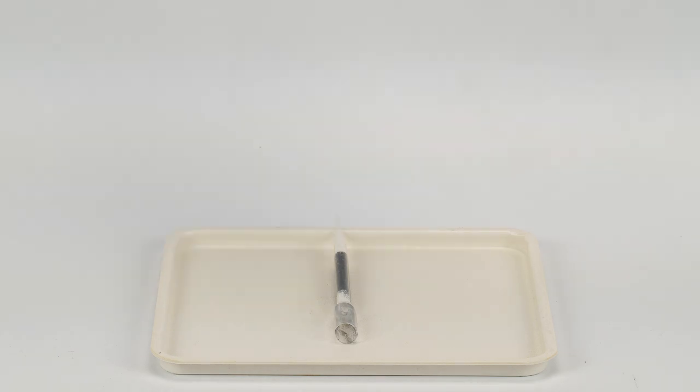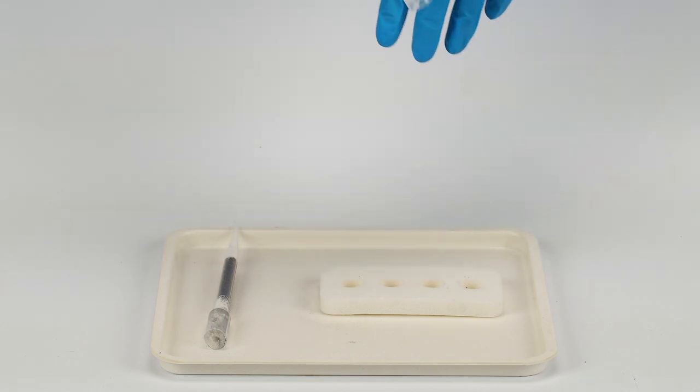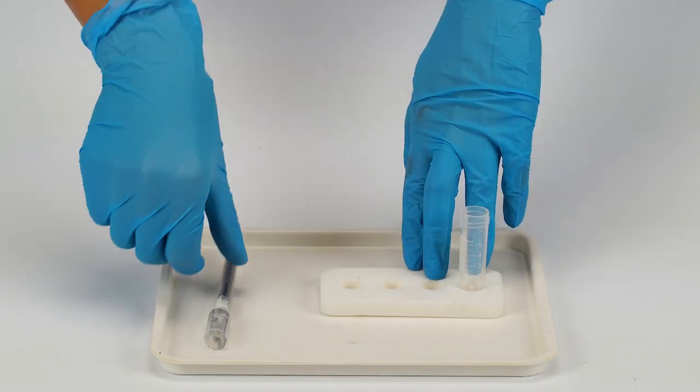Now, set up the test stand. Put a vial into your vial stand. Put the assembled carbon filter into the vial.